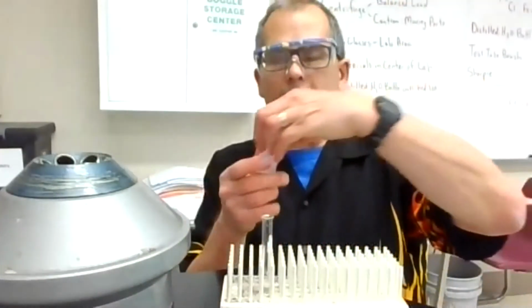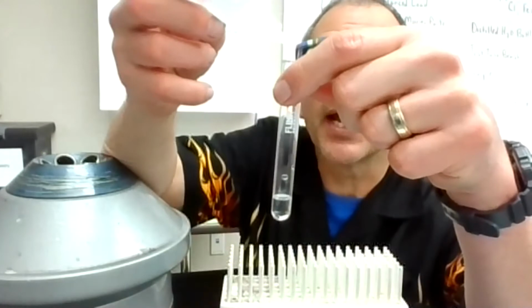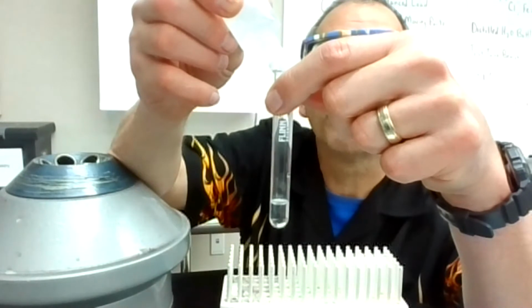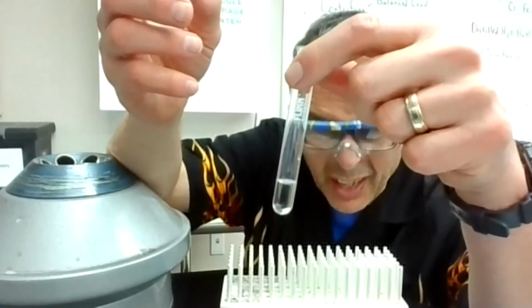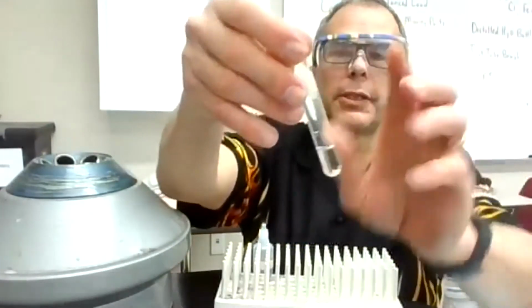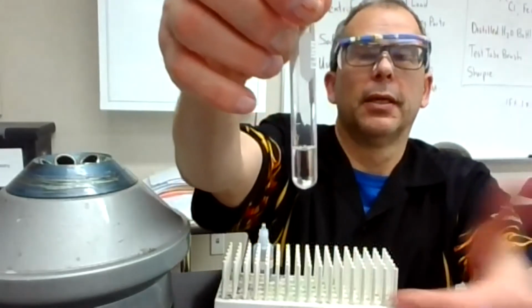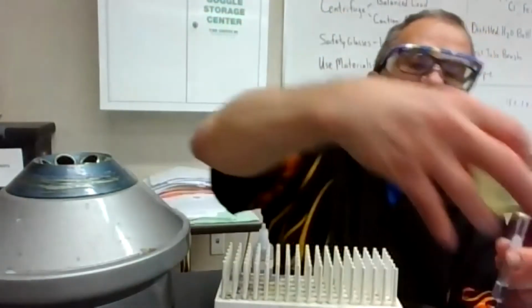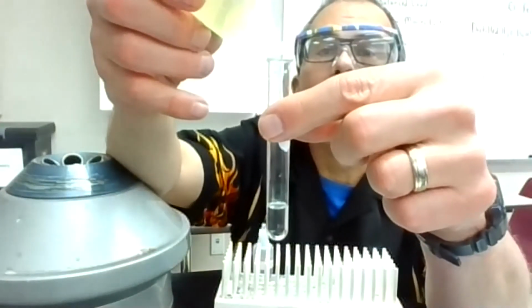And the first one I'm going to add is Cl-. So I'm going to look at this Cl-, get this in a spot where you can see this as I add the drops. And I'm going to go 1, 2, 3, 4, 5, 6, 7, 8, 9, 10. Okay, looking at that, it looks very clear. You know, I can mix this up. I should probably do that, but no need to centrifuge it or decant it because it just looks like a clear homogeneous solution.